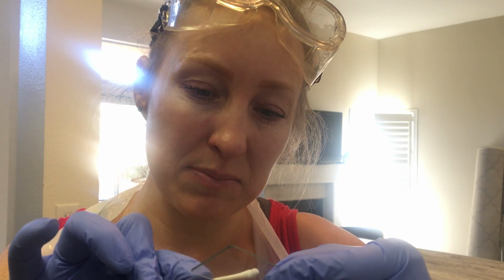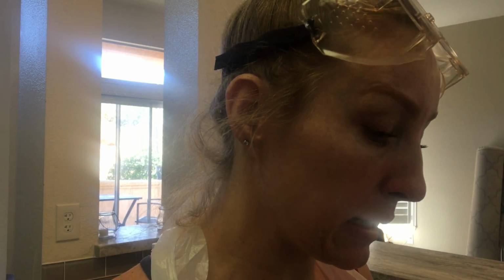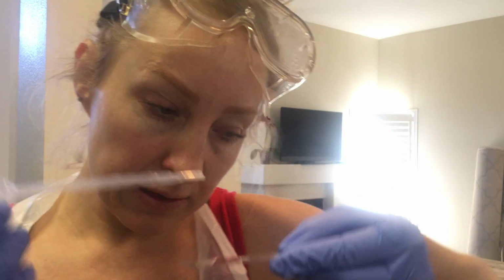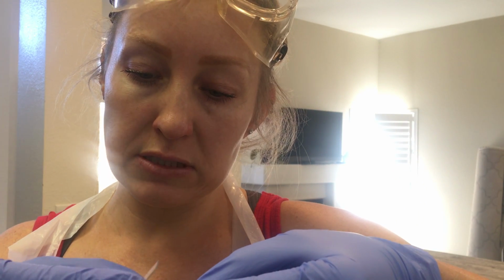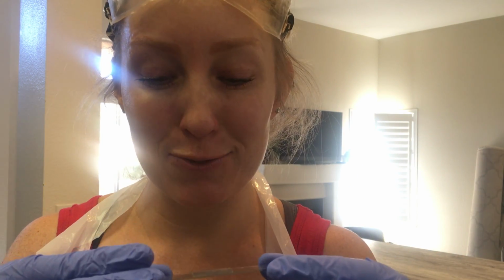And I'm going to put it on one of my slides here, right smack in the middle. I'm really going to try to rub it on. And then I'm going to take my pipette and put some distilled water in it. This pipette has already been cleaned with some rubbing alcohol. I'm just going to put a little drop, okay? A little drop on there. And with my slide cover, you're supposed to go at an angle, slowly drop it. And then we're going to see what's under this bad boy with the microscope.